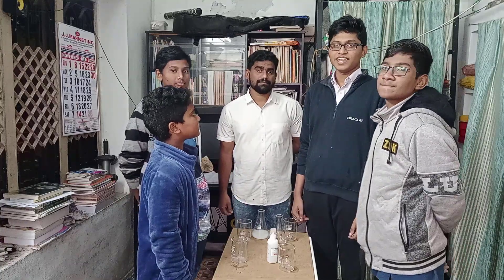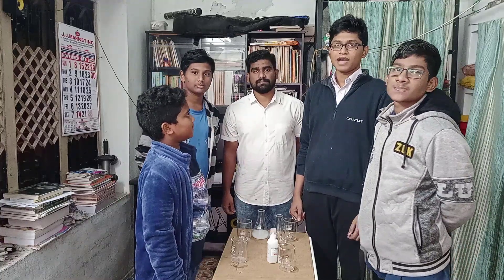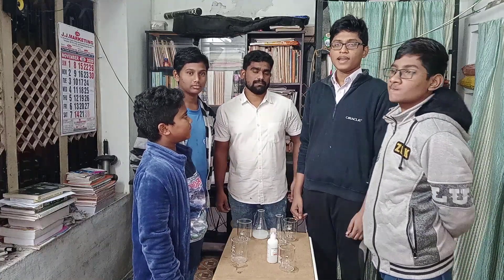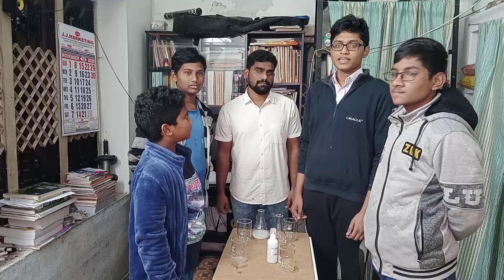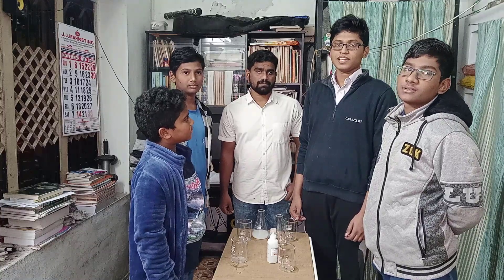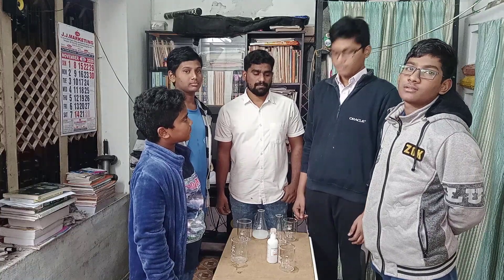Hi friends, we are studying 10th class in Bajis Academy. Now we are conducting experiments on acids and bases in class 10.